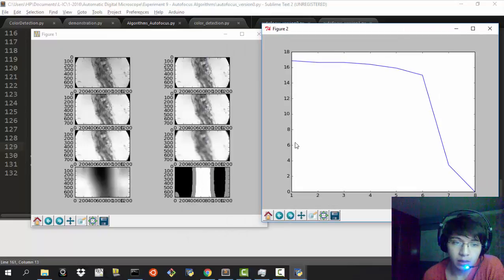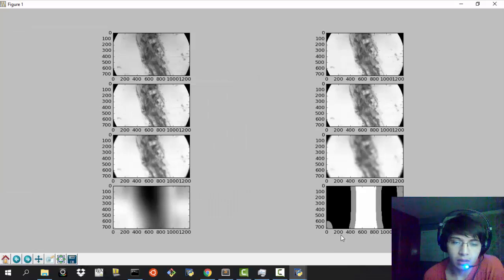I don't know why this is being displayed like this. Okay, this is the original image, the one that I have shown you. This has more blur, extremely blurred, more and more blurred, and here it is completely blurred. It's actually all white. Just for you to believe me, I'm going to show you this using imshow from OpenCV, because I checked this and I don't know why this happens, and I don't have the time to solve it. I just know that it is working, because if I display this in OpenCV, then I have a more blurred image than this.